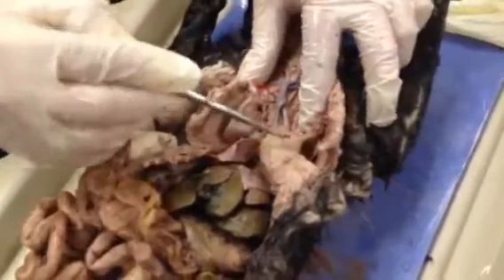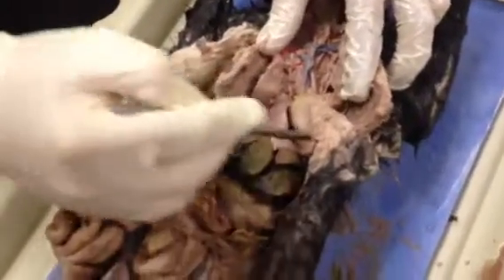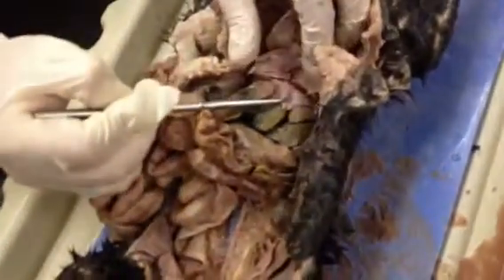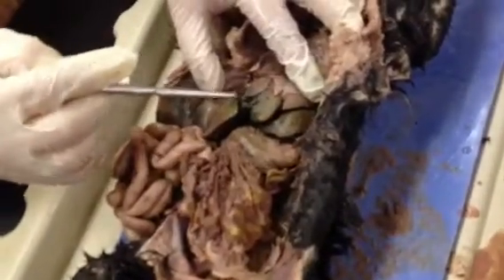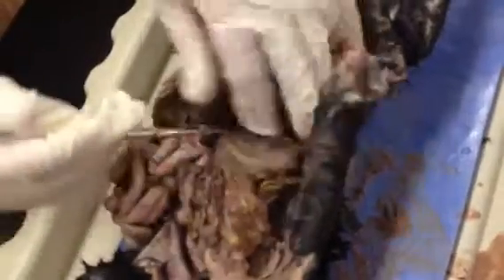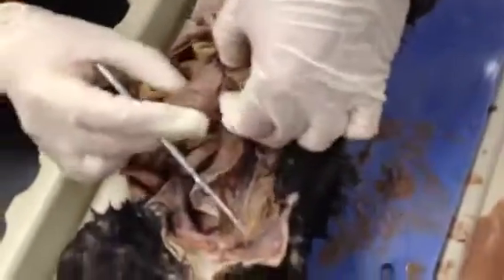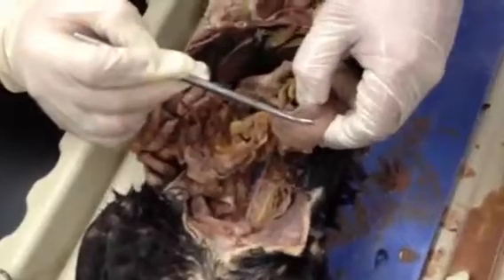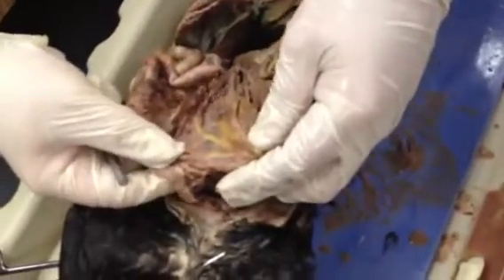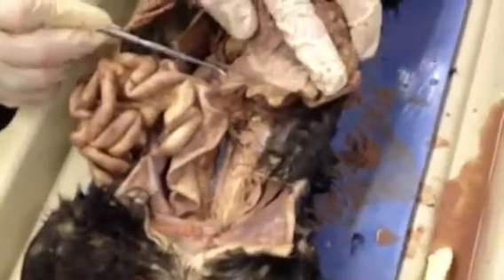Okay? If we look over here, we have the heart, we have lungs, we have another lung over here, and this right here would be the diaphragm. If we go below the diaphragm, we have the liver, with the gallbladder being here, with the bile, and bile is green. Underneath that, we can see the stomach, and on this side, we can see the spleen. Branching off of the bottom of the stomach, called the greater curvature of the stomach, we have the greater omentum, and if we reflect the greater omentum upwards, we can see the pancreas.